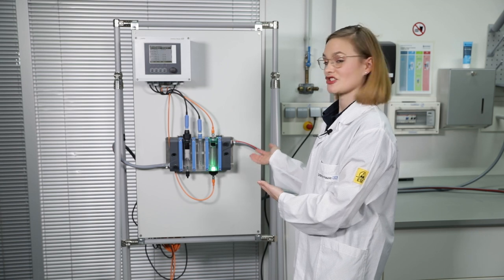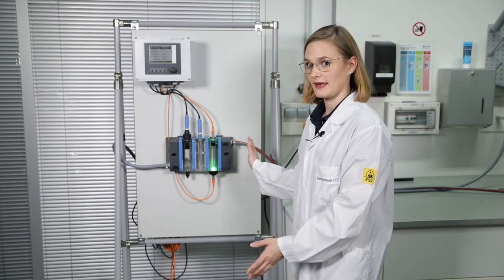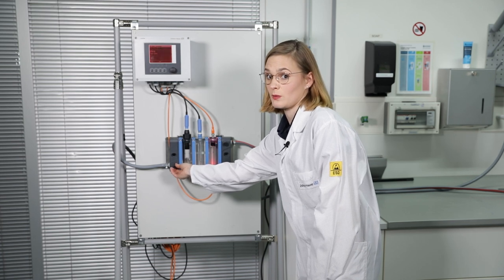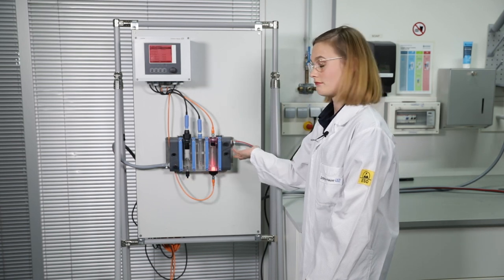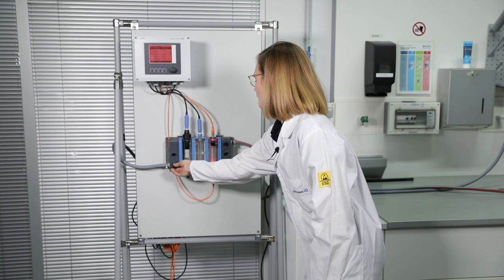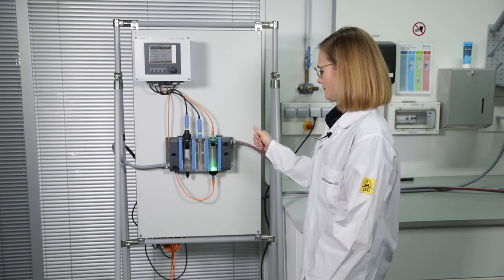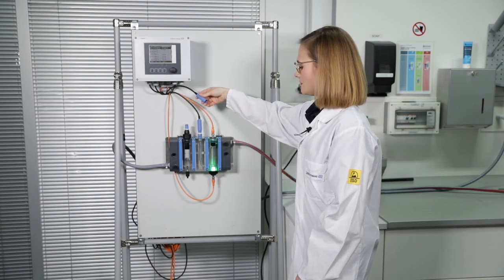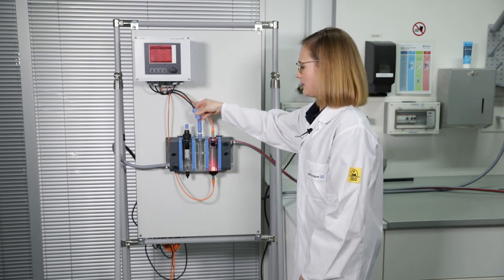Does the light shine green when everything is okay? Yes, it does. And does it turn red when you shut down the flow? It does. Does it turn green again? Perfect. And what happens when you disconnect the sensor? Perfect.